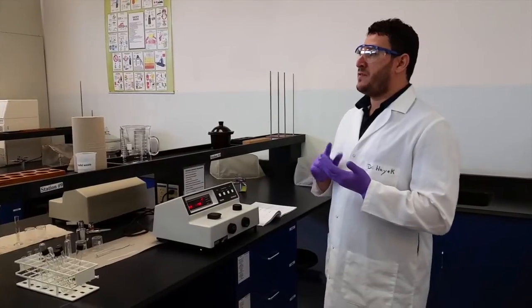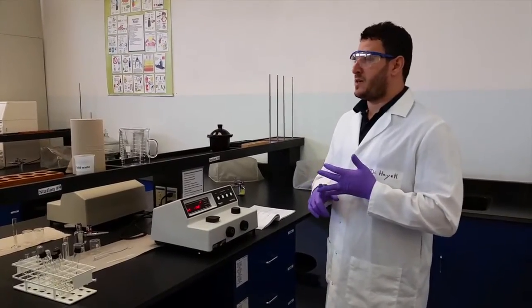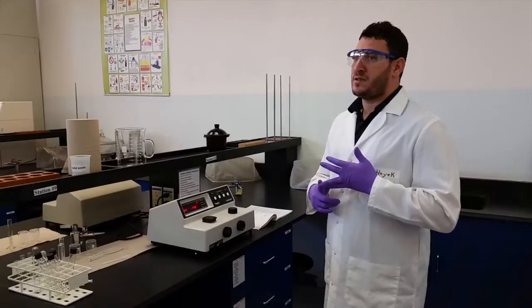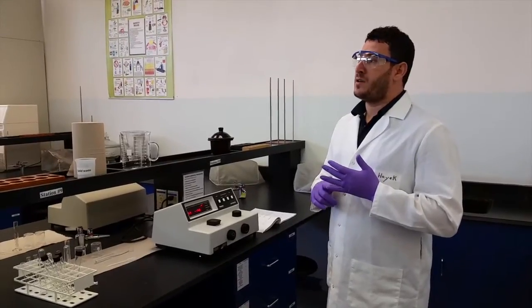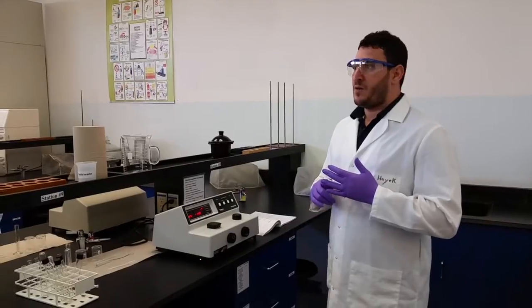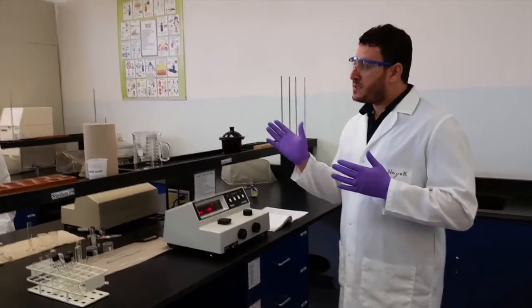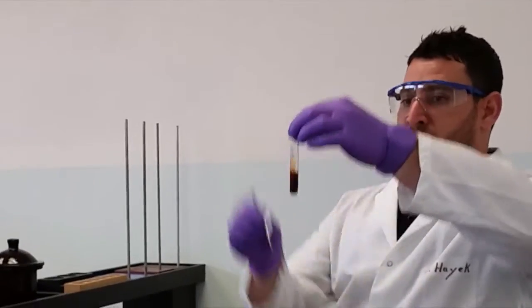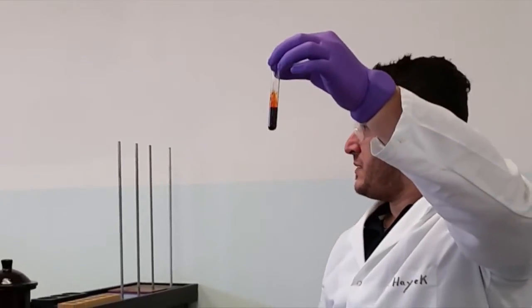When you add phosphate, it consumes the Fe3+ and the equilibrium shifts to the left, where Fe3+ and SCN minus are both colorless. However, if you shift the equilibrium to the right, you will obtain this dark brown color which absorbs light.